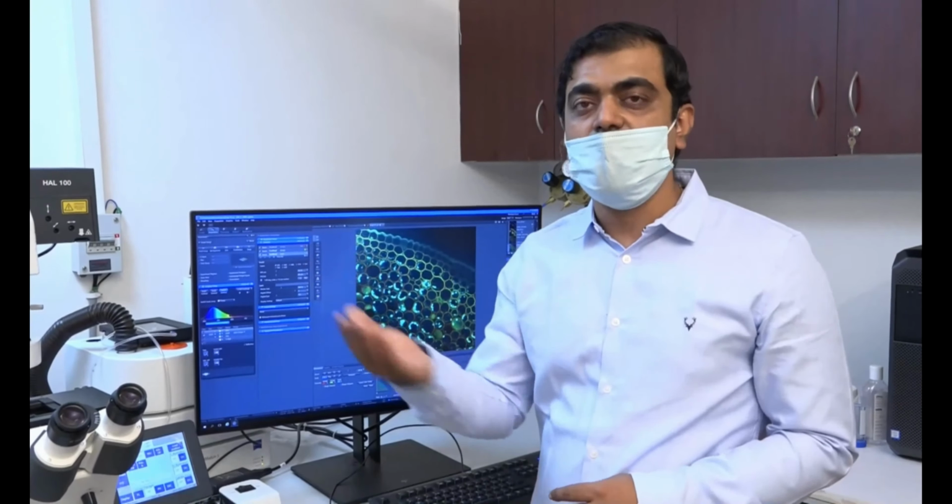So once the red is taken, now the green. As you can see the green channel, you can select the green. The experiment process, you can see here what is the time it is taking. The entire experiment process can be visualized from here, and at the same time the percentage of the progress of the experiment can also be seen, or keep a real time tracking.